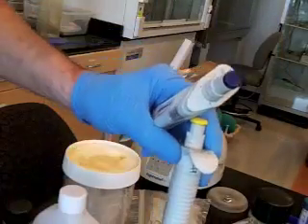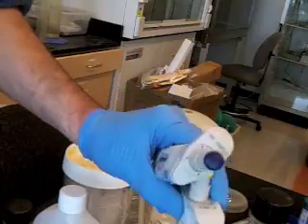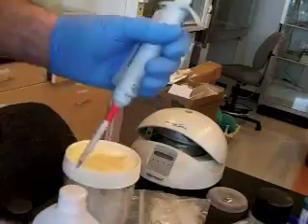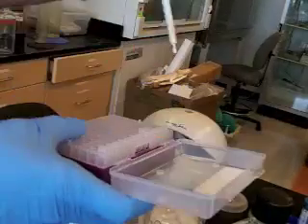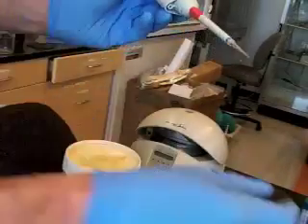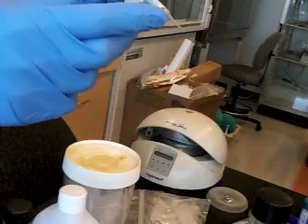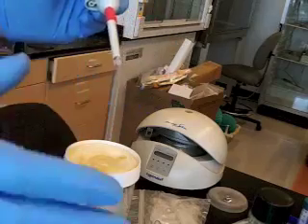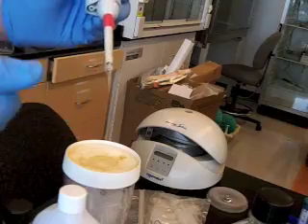And then we have yellow tips for these smaller volumes, like that. And then there are a variety of specialized tips, sometimes for a smaller volume micropipetter like this one, boom, little tiny tip. Sometimes the tips will have a little cotton in them. They're called aerosol resistant tips, and this one doesn't have it, but they have a little cotton tip in there to protect the liquid from contamination.